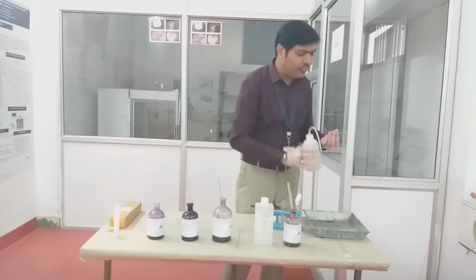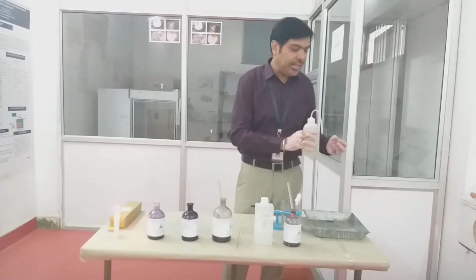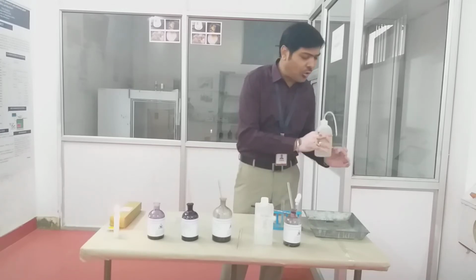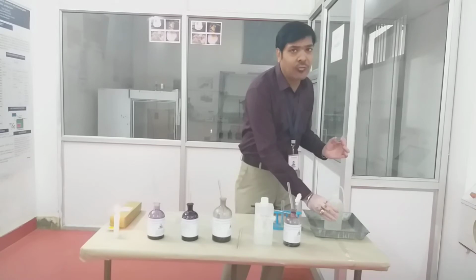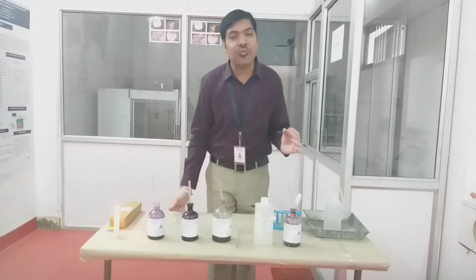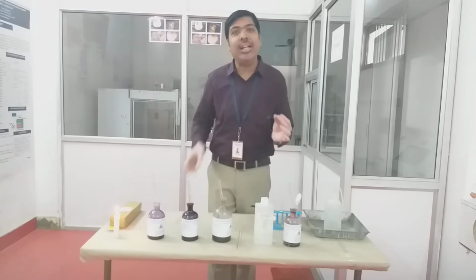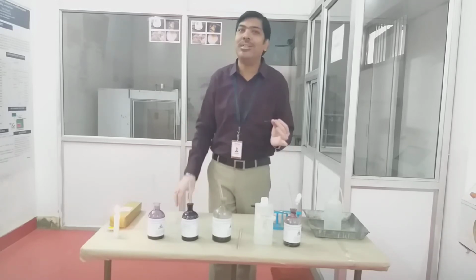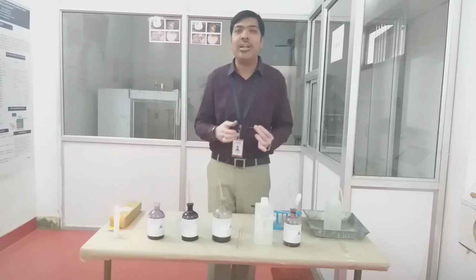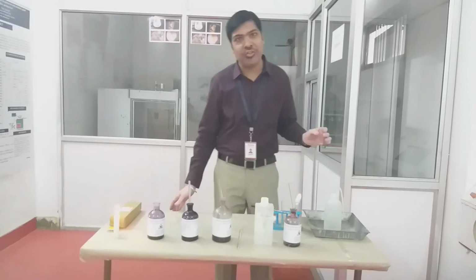When we are washing the slide, the thing we need to remember is that when we are applying the water, the stream of water should be parallel. It should not be perpendicular. You can wash this with tap water also, but still the stream of water should be parallel, because if you use a perpendicular stream, then the microorganisms which are already fixed on the surface of the slide may be washed out of this slide. Then nothing will be visible under your microscope. So we have to use a parallel stream of water in order to wash the slide.